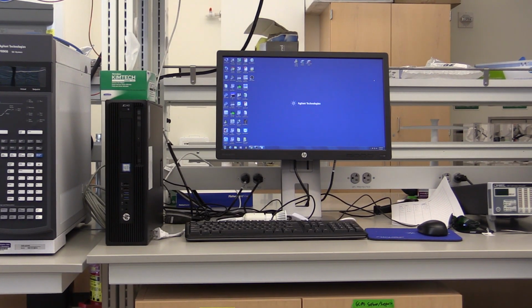The computer we use to run the RTGA software is to the immediate right of the instrument, so make sure you reserve the appropriate time on Coral and enable it to start running your scan.